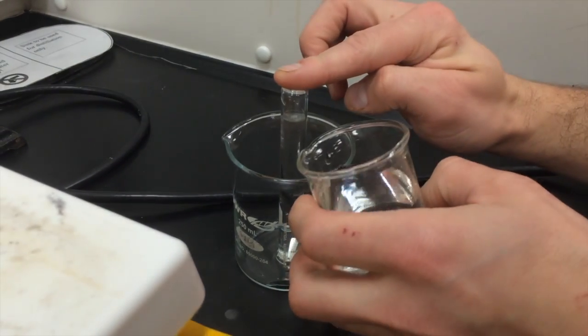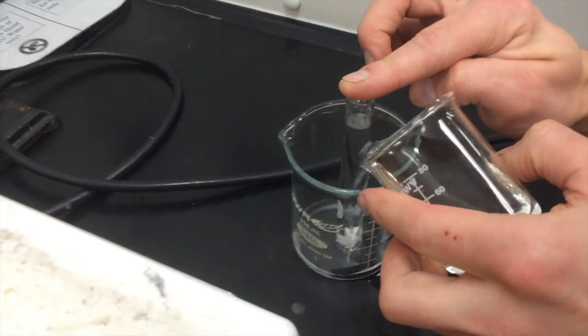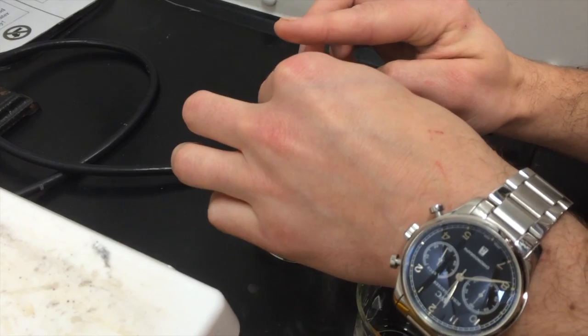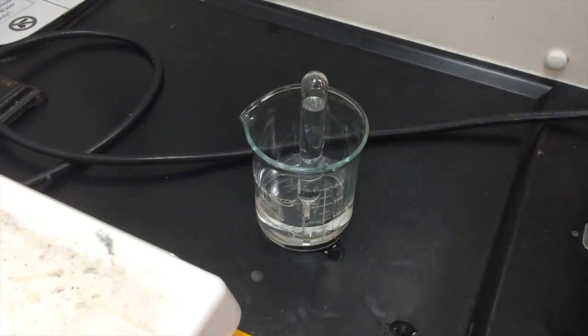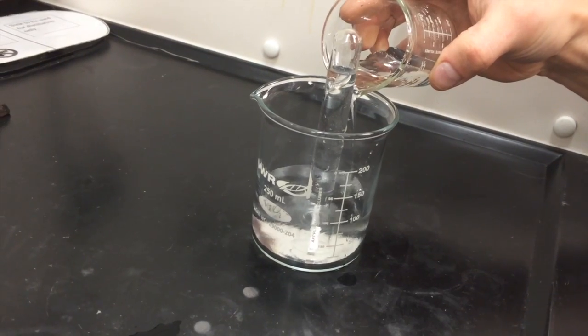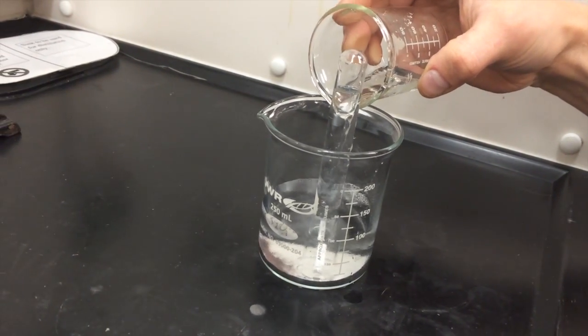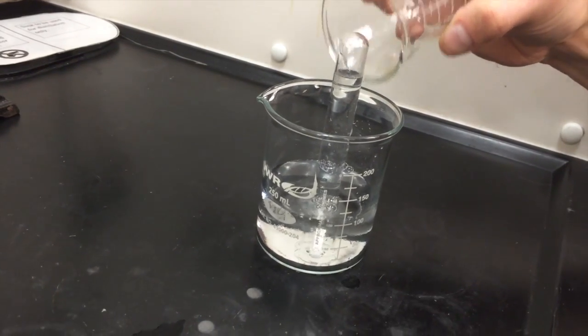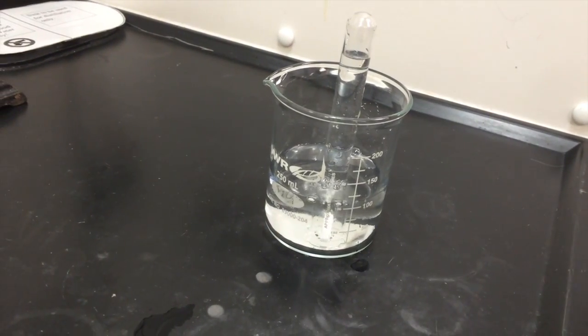Now, carefully add water, and then add the hydrochloric acid. Make sure a reaction is occurring in the beaker once you add the acid.